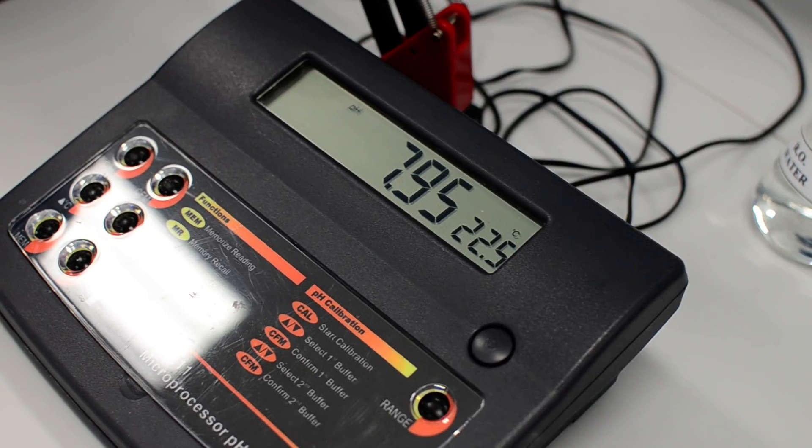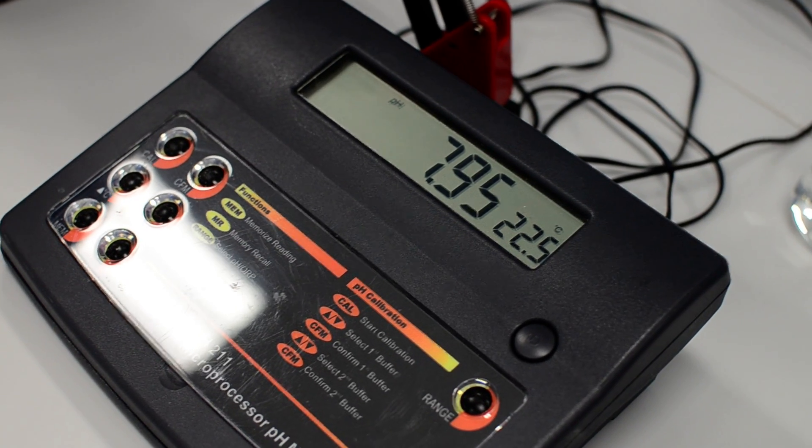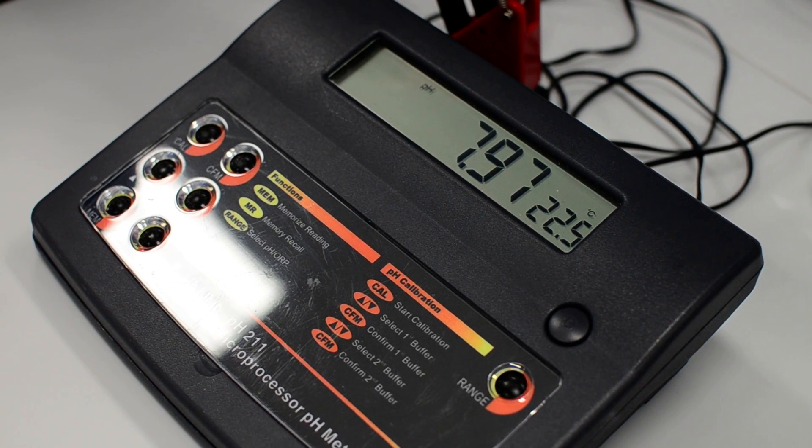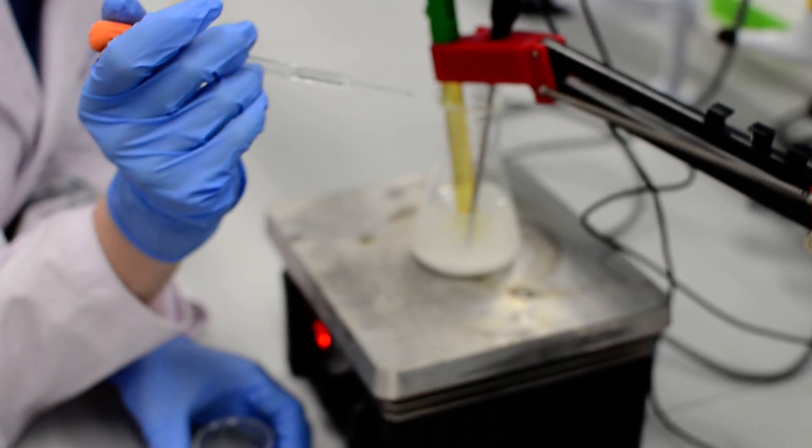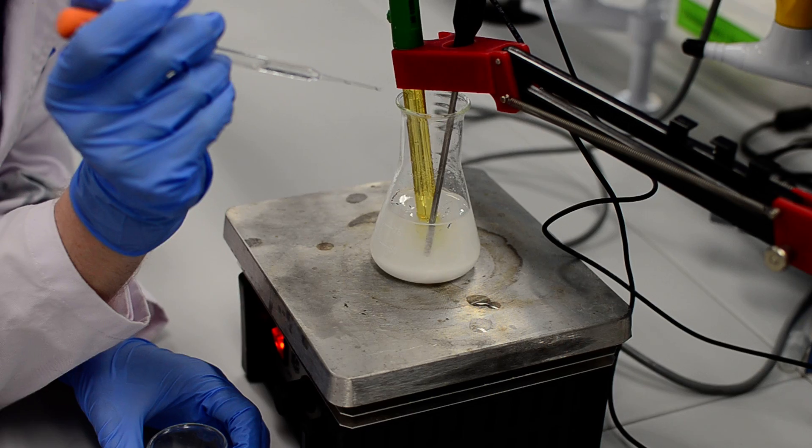7.96. It's 7.95. It will go up and then down. Oh, 7.97. Look at the exasperation on Dave. I just told you. Told you it would go down.